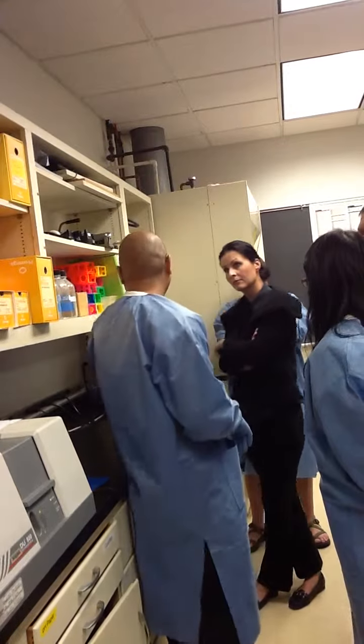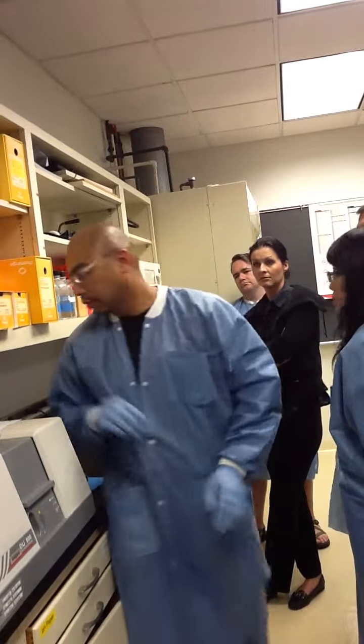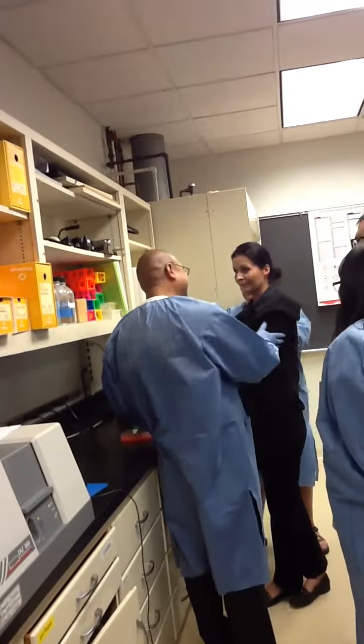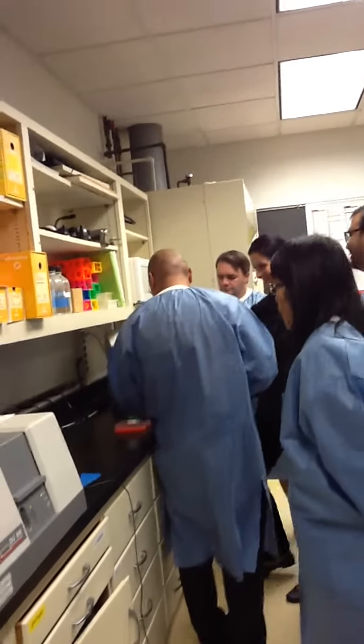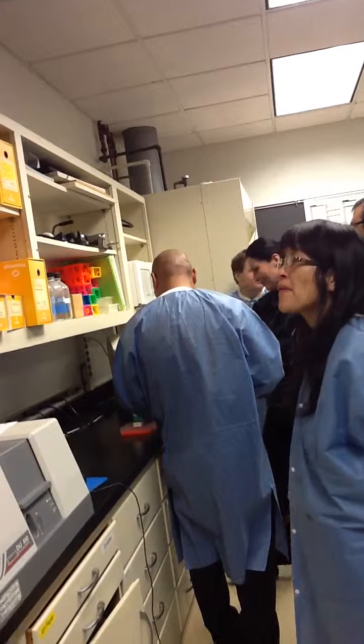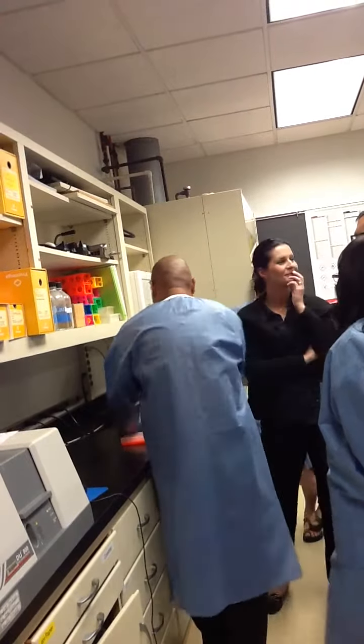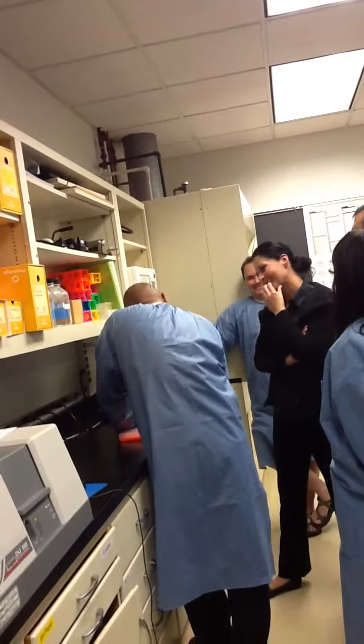Oh, the 72 is at 0, so it's wrong. Thanks. Look at that. I just reprogrammed this thing, so let's turn this on. Keep our fingers crossed.